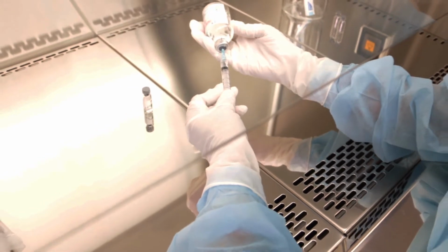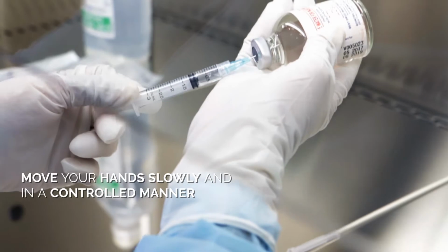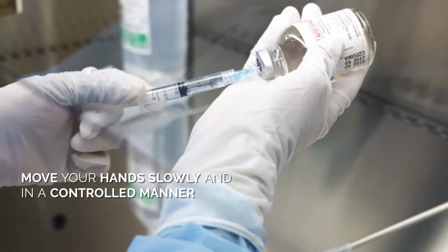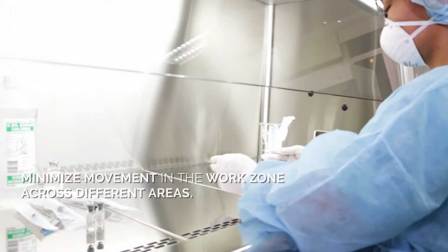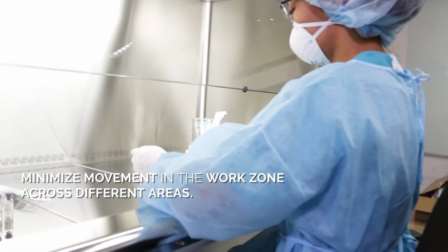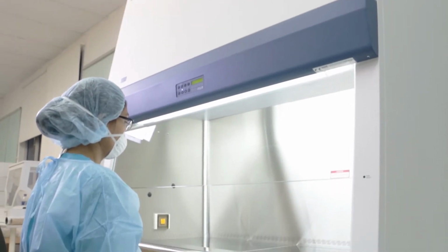While working in the cabinet, move your hands slowly and in a controlled manner. Rapid movements may disrupt the air barrier, allowing contaminants to escape or enter the cabinet. Minimize movement in the work zone across different areas. Leave the blower on for 3 minutes to purge airborne contamination from the work zone.